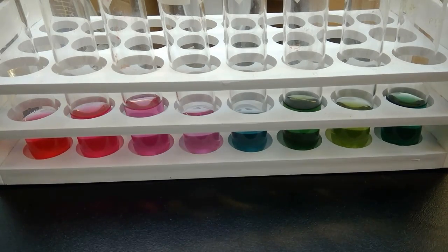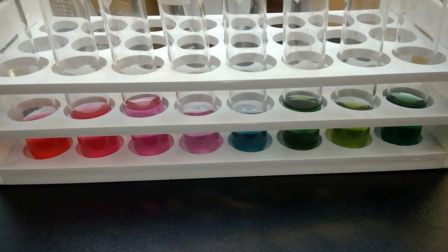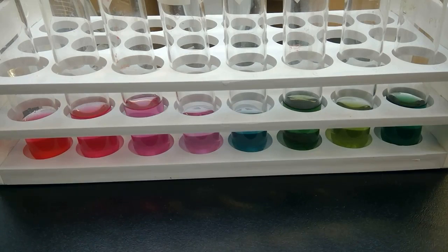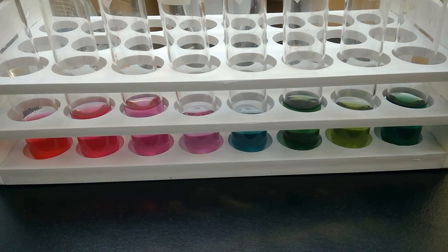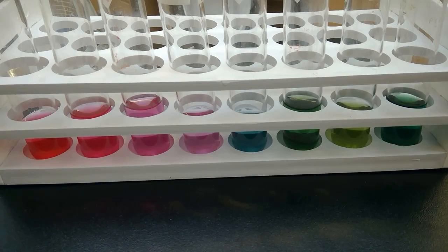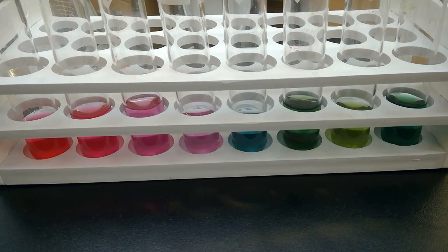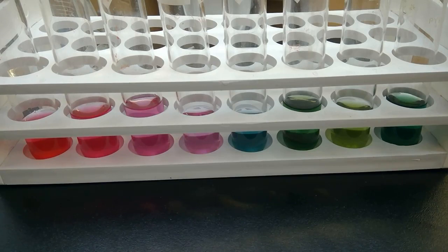It could be organic white grape juice. Does anybody know the pH of this? Anybody know the pH of seltzer water? We're going to test to see what the pH of these are based on comparing the color your unknown solution turns when mixed with cabbage indicator.